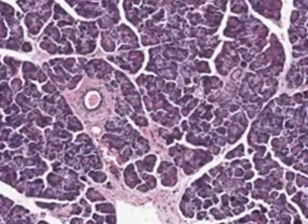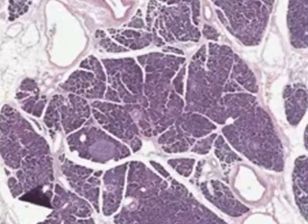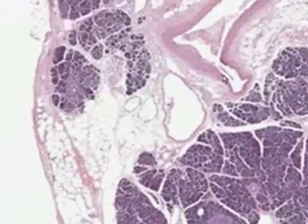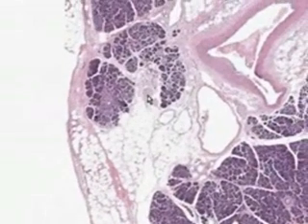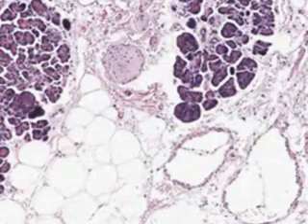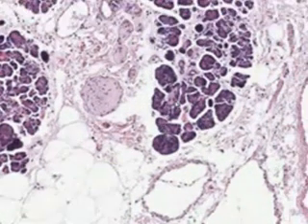And notice also the pancreas has a good amount of fat in it as well. There's fat there, there's fat there. Notice the large artery here. And what do you think this guy is? I bet you it's a nerve. Let's blow it up and prove it. Yeah, it's definitely a beautiful little nerve, isn't it? And there's a tiny nerve, and there's a tiny nerve, and there's a small artery, and there's a small artery, and there's a nice little vein. And here's fat, and here are some more veins, and here are some lobules.